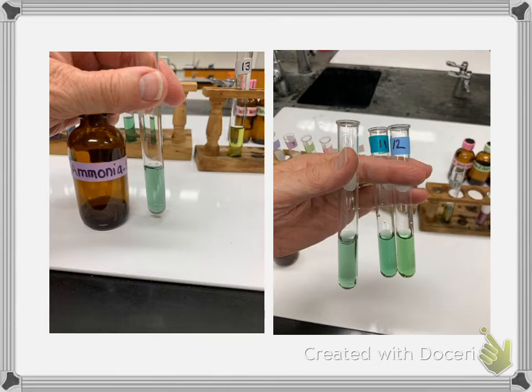Now your data also has a column for the pH measured by the digital meter. Currently our digital meters are not functioning very well, so I did not measure it with a digital meter. Digital meters have the advantage when they're calibrated and working well of giving you a decimal number, and so it is accurate, and when calibrated, very precise.